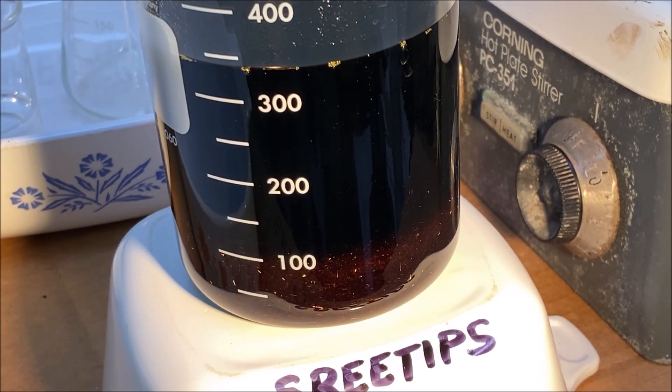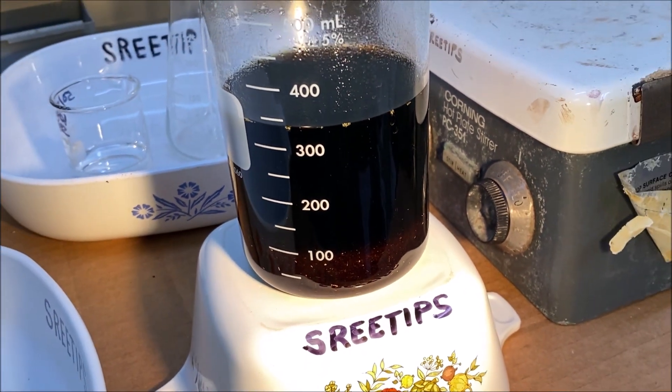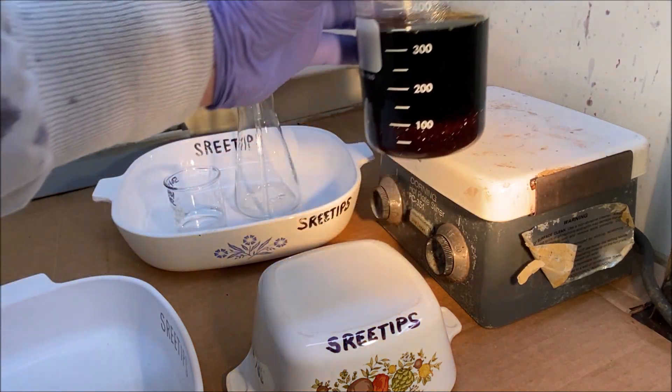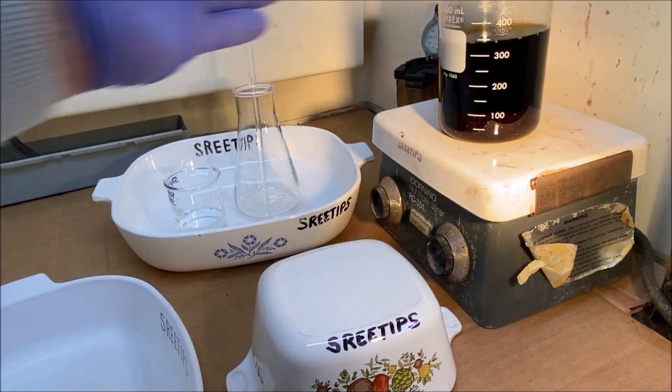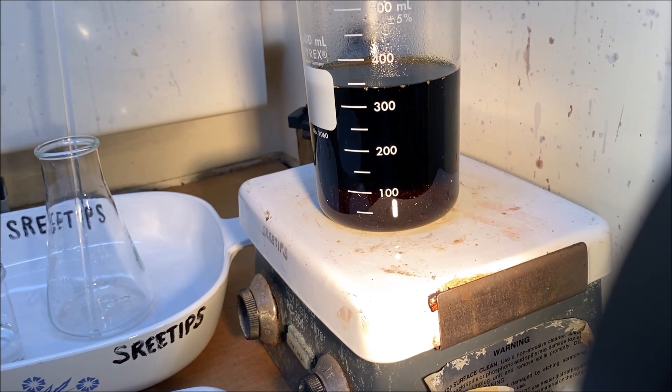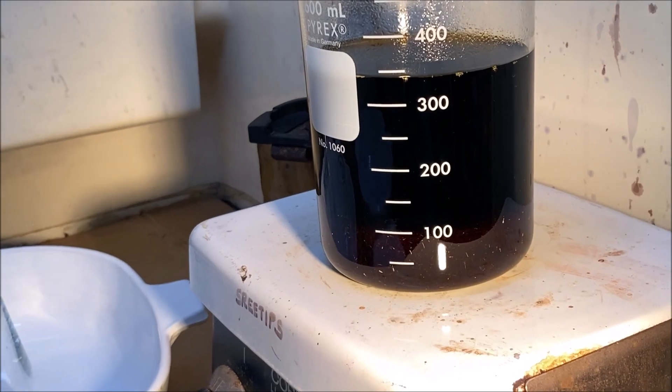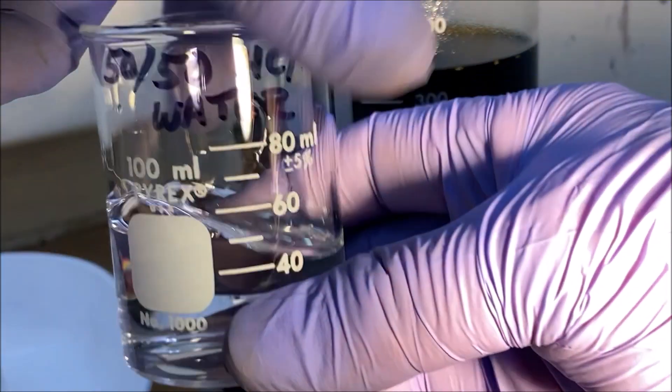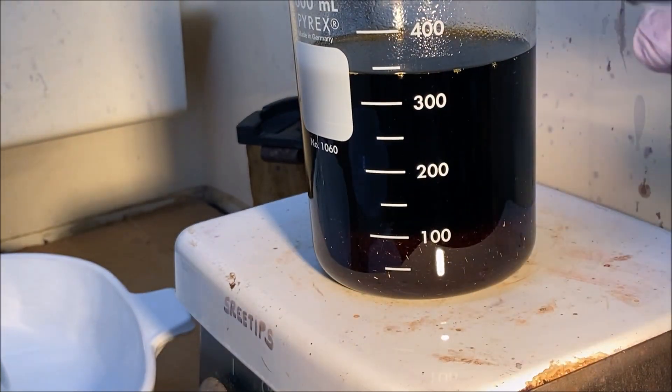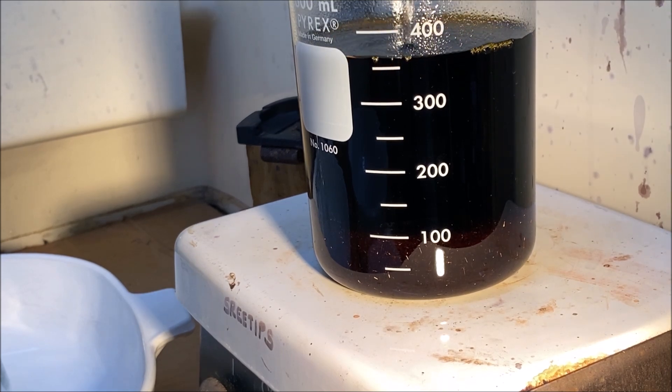I've allowed this to cool a little bit and as you can see the crystal formation has reappeared. So I think what we'll do is set this up on the heat and I'm going to add small doses of the hydrochloric acid to this, and we're going to try to get those crystals to clear up. Hydrochloric acid dilute. And once we get them cleared up, then we'll be ready for the next step.